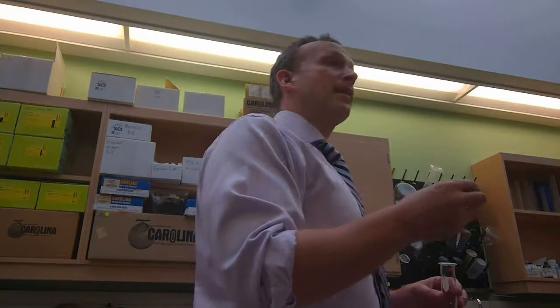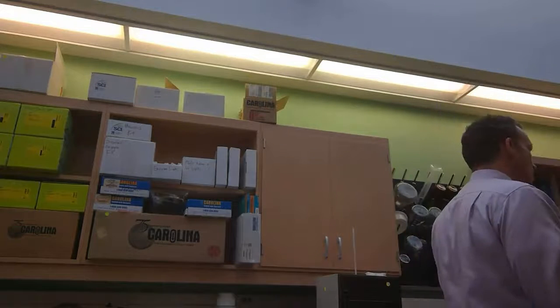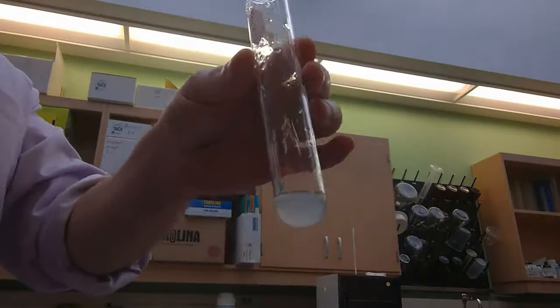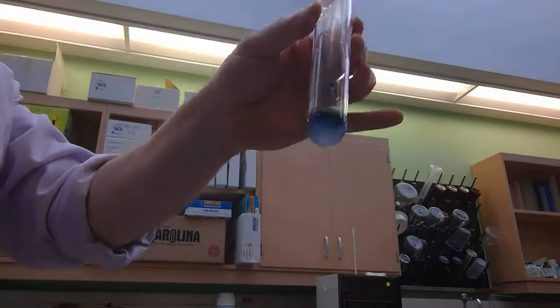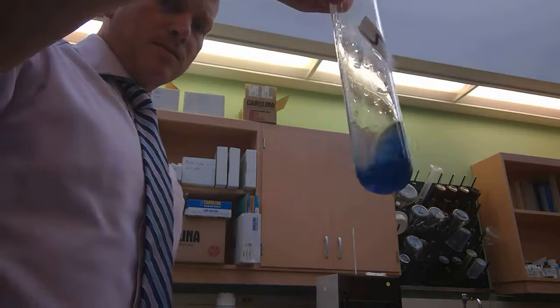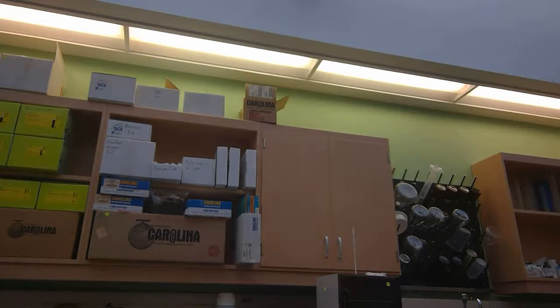So somebody check on the protocol. It should turn black, right? Because it's loaded. We already know that it's loaded with polysaccharides. Starch is a polysaccharide, right? So watch this. As we add it, do this for our friends at home. Look, you guys see it? It's actually kind of a cool result, right? Change black. So it's like a bluish black here. But definitely a positive result for polysaccharides, right? That's an easy result to see.